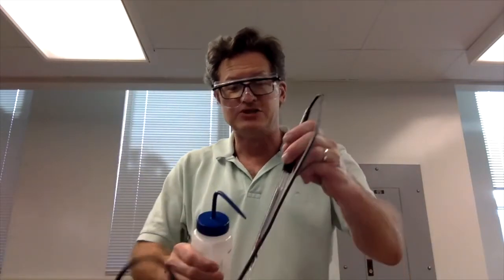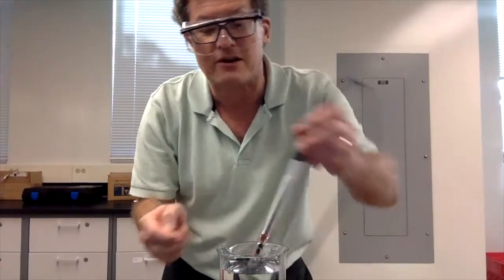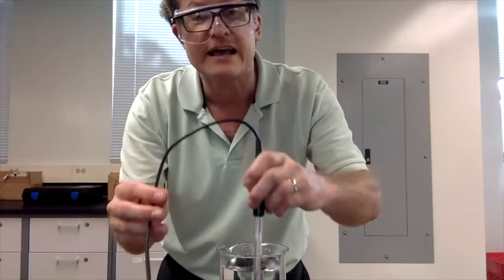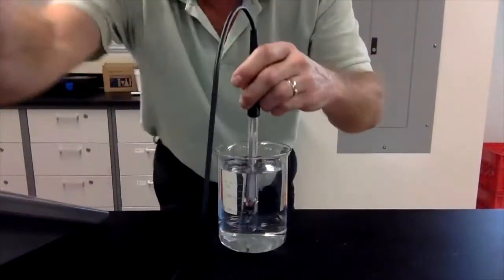So we've got to be meticulous about cleanliness in this one. It's not okay to simply rinse this off, because if you just rinse it off out here, wait a minute, where do we measure? We measure on the inside of the tube up there. So in order to really clean this off, we need to swirl it in a nice big beaker. Look at it, that's a big beaker of water, because we need cleanliness in this one. This is very important. So we need to clean it on the inside, not just the outside. You can't just rinse it with a wash bottle. You need to rinse it on the inside as well.